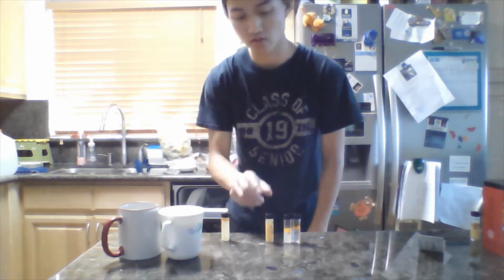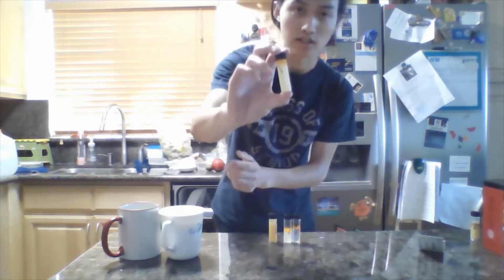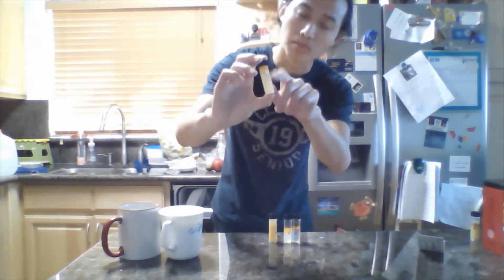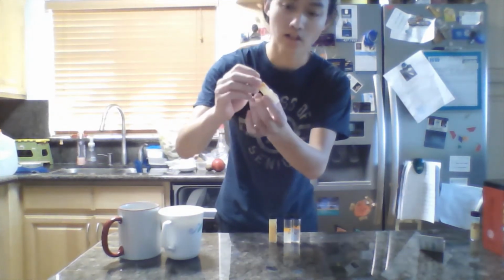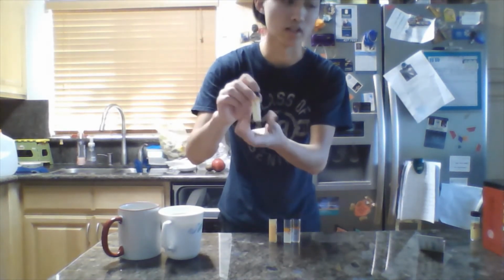Actually, I had to redo this vial because during my experiment, the original vial spilled and some water got in, and I noticed an interesting effect where the solution remained as an emulsion, likely because of the introduction of so much water. The egg emulsifier couldn't actually dissolve all of the oil into the water.